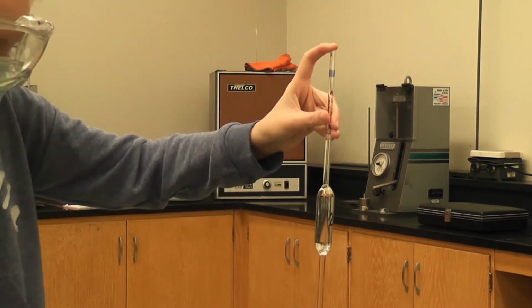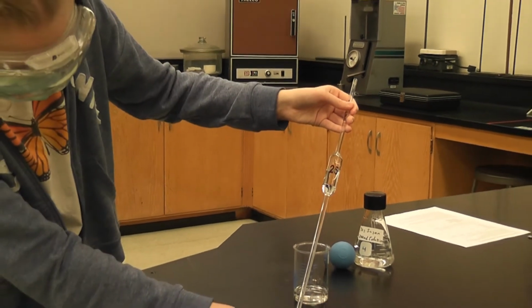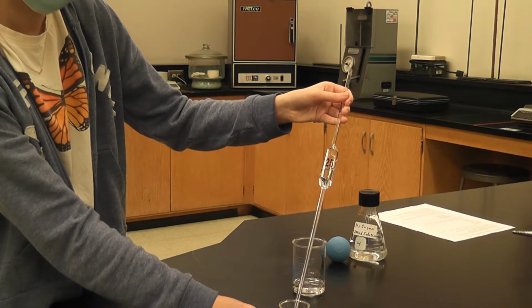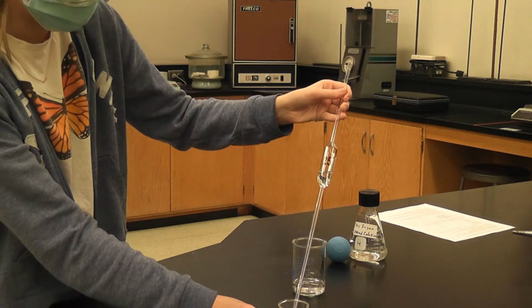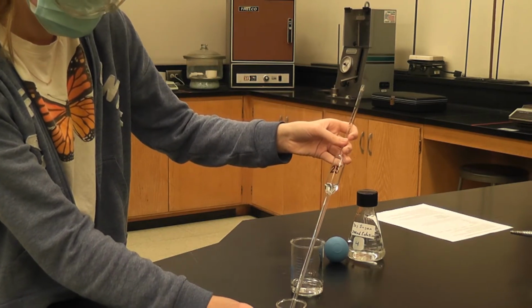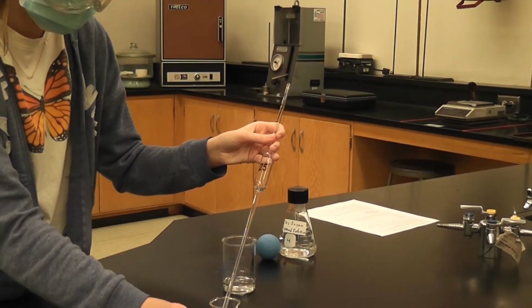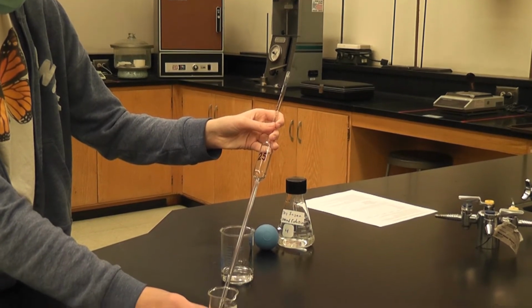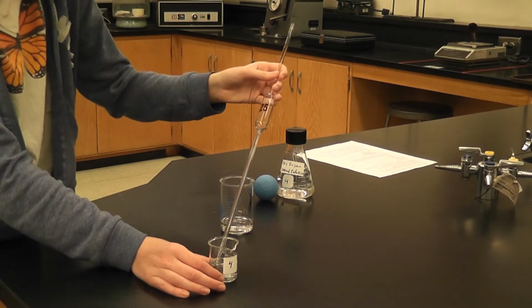And this is the bottom. Which solution is this one? This is solution 4. So number 4, okay, the 30 grams per 200 milliliter. Perfect. Bottom, and I'm going to wait 30 seconds.